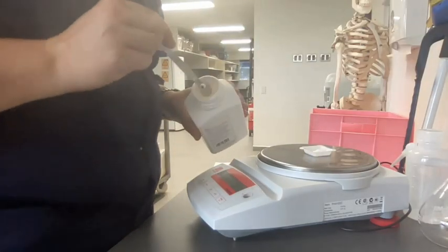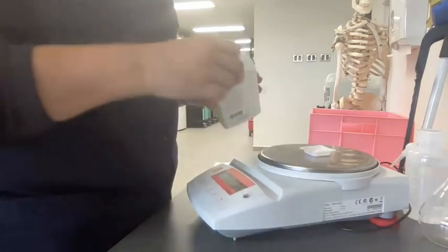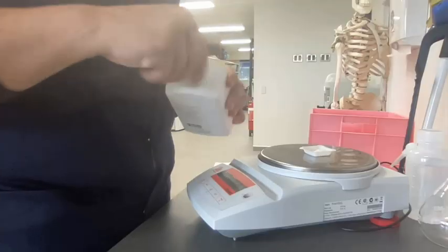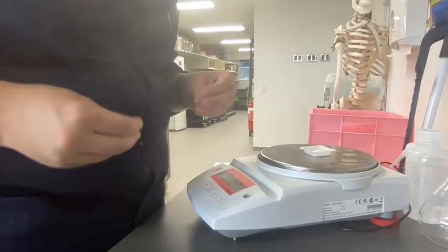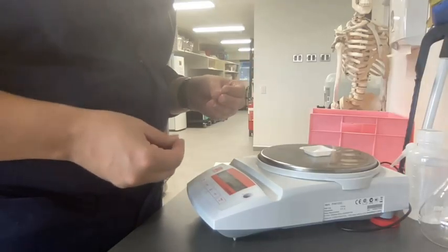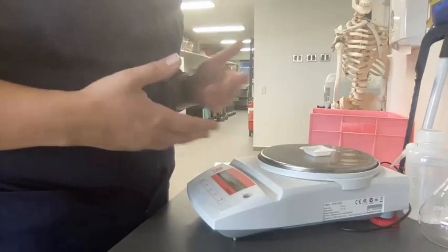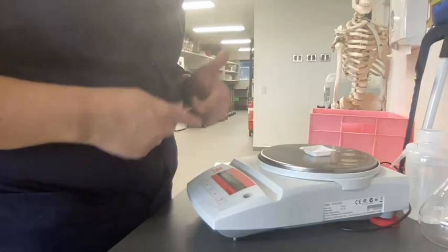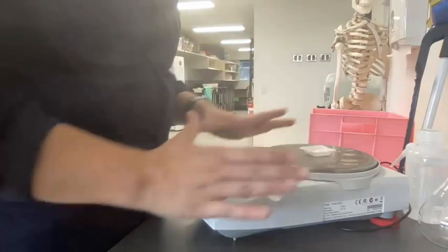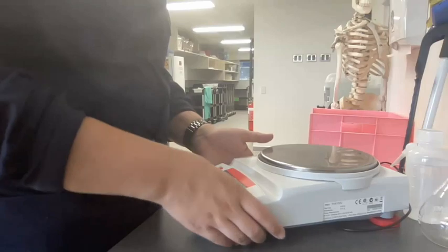If you go a little bit over or under, it actually doesn't matter as long as you record down the exact mass that you have so that you can work out the exact moles that you have, because that's what this is about. It's about creating a primary standard where you know the exact concentration of that substance. So it doesn't matter if it's 2.00 or it could be 2.15, as long as you record and know the exact amount, that's okay. So I've got my 2 grams. So I'm just going to move this out of the way.